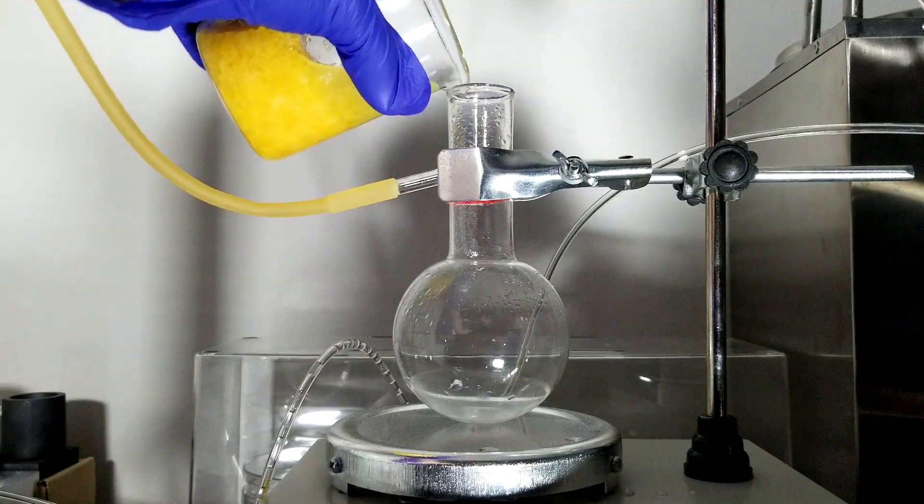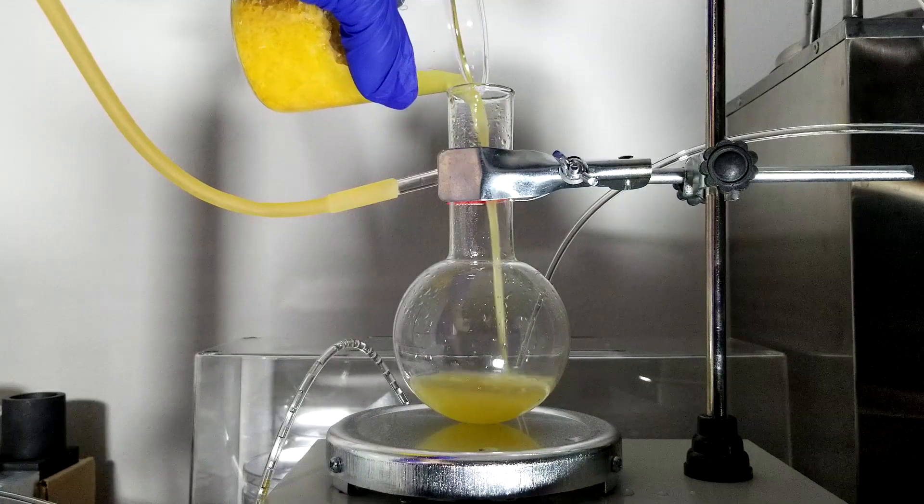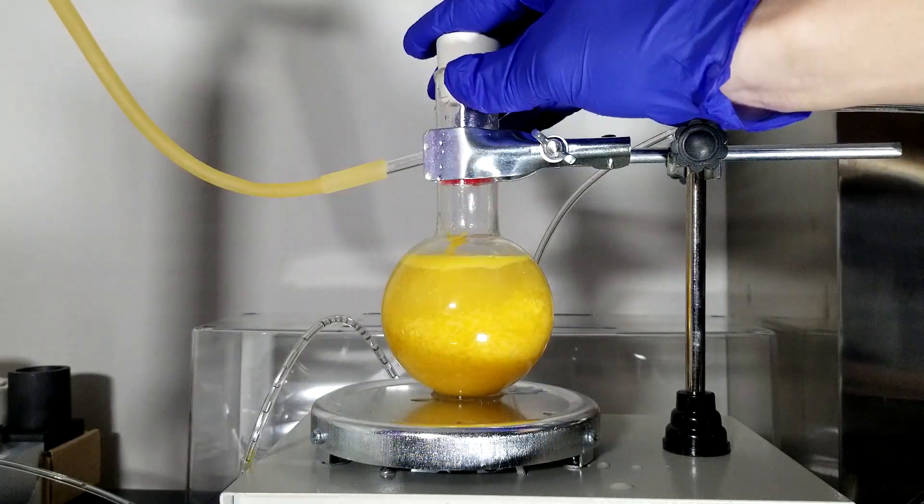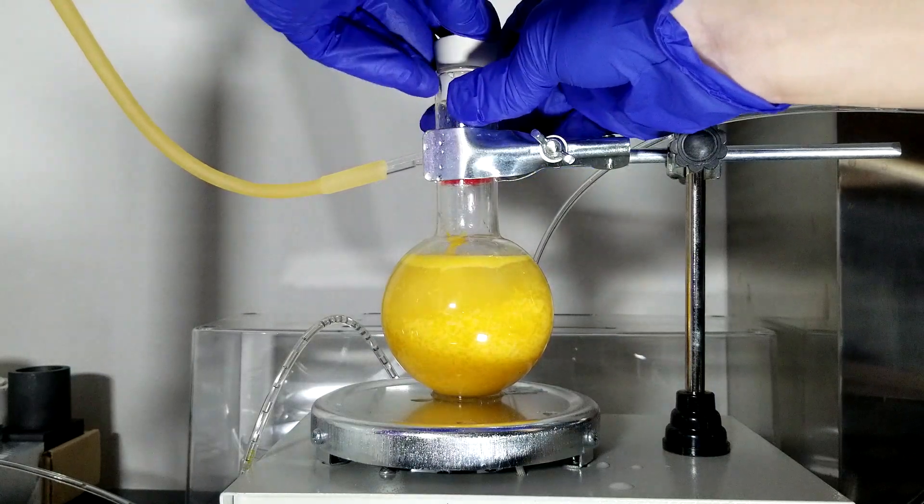After that, I transferred everything into the distillation chamber. Note that I had a little bit of difficulty transferring it. Once I finished transferring into the chamber, a rubber stopper with a thermometer is placed on top.